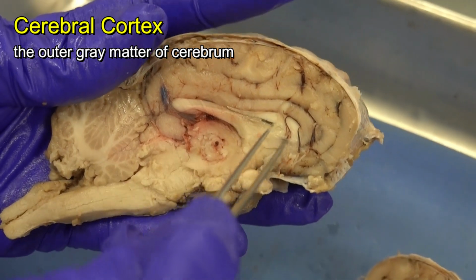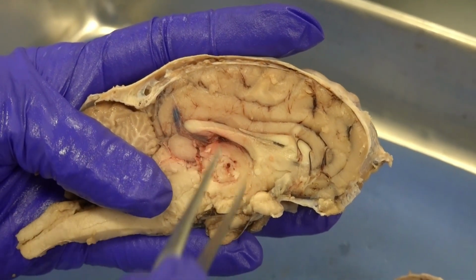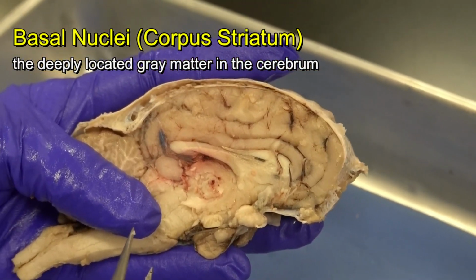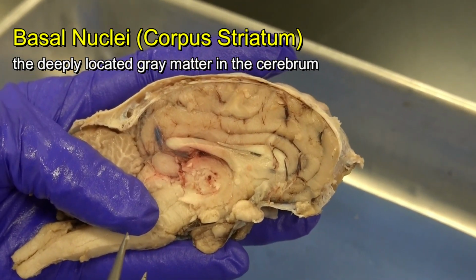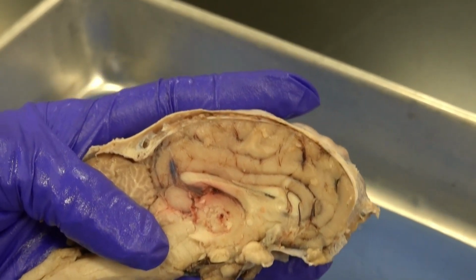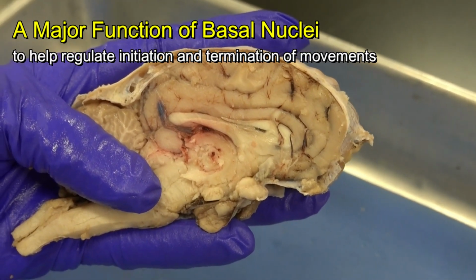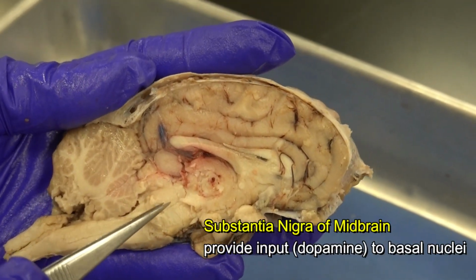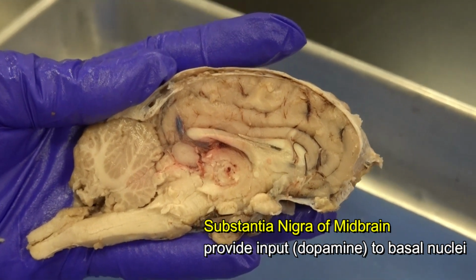And deep inside the cerebrum, even though it's not very easy to see in the sheep brain, we do have some other gray matter, which we call the basal nuclei. Recall that basal nuclei have a significant role in sending output to motor areas, for example, to initiate and terminate body movement. If basal nuclei do not receive enough input, for example, from the substantia nigra of the midbrain, then we end up with a disease such as Parkinson's disease.